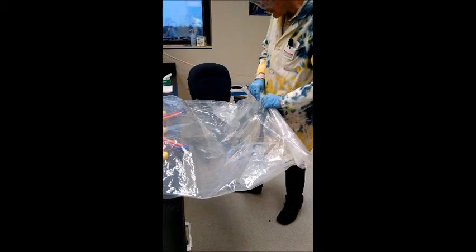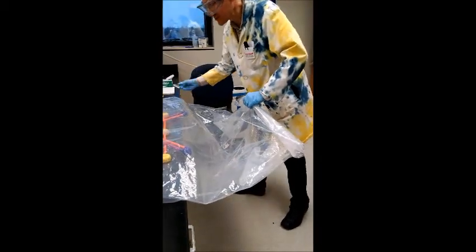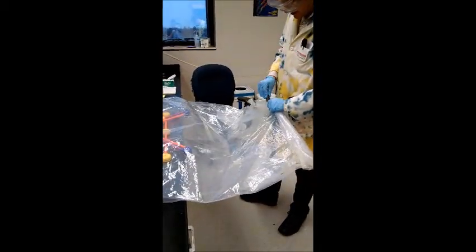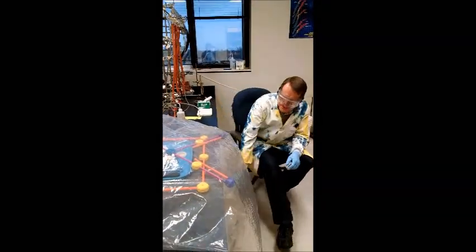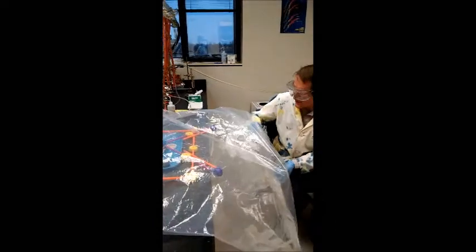So we'll do that a total of three times and then we'll refill it. Each time we purge, fill the bag. For the fourth time we're ready to use it and I'm going to have a seat to conveniently work at the hood.